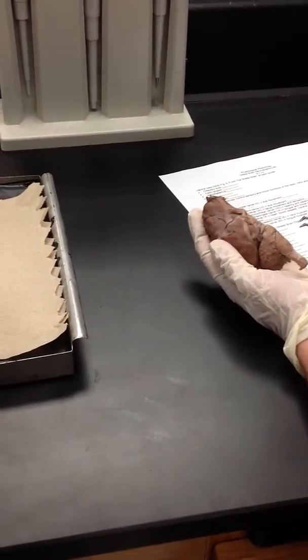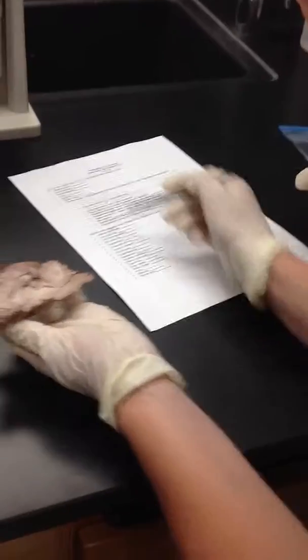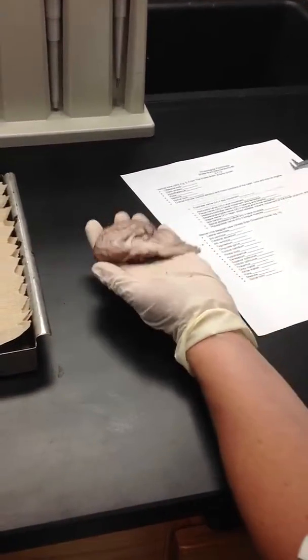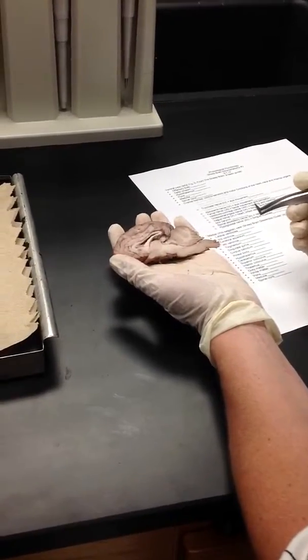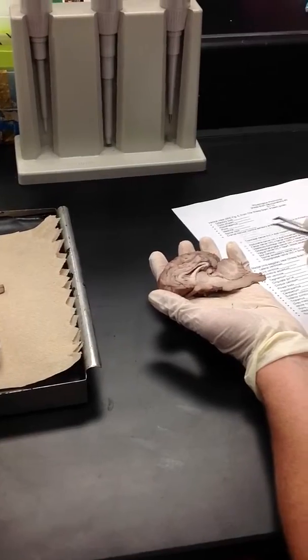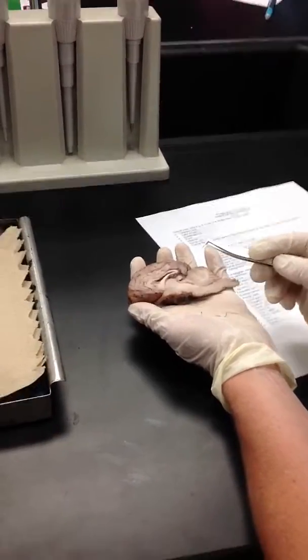Different things are easier to see in certain views, right? But that basically covers this list of things here. We're going to have a cut brain on the test with a pin sticking in it, and normally there's a number on it.